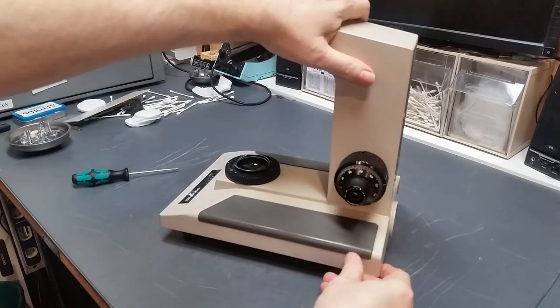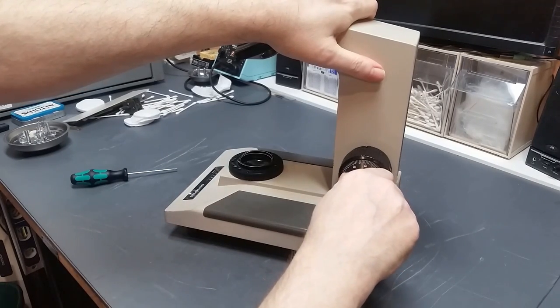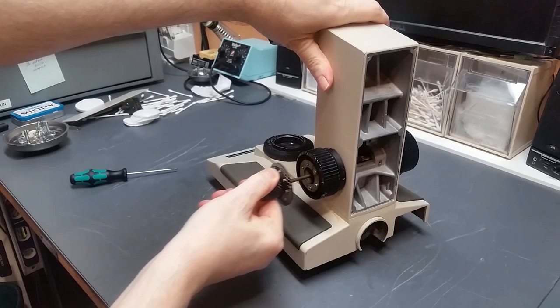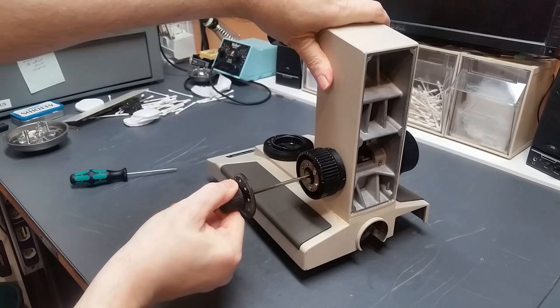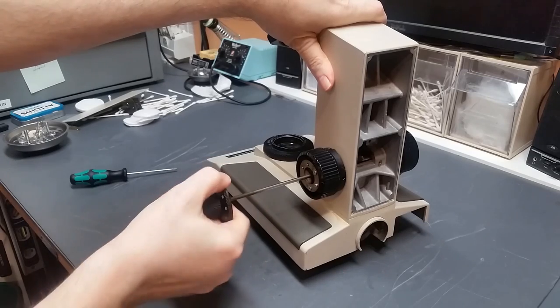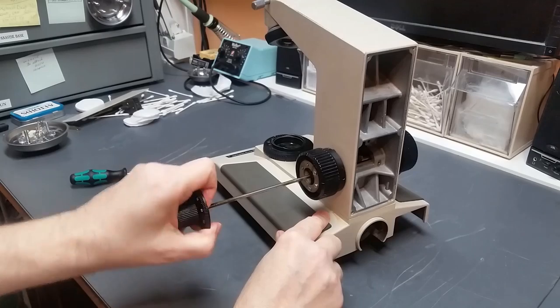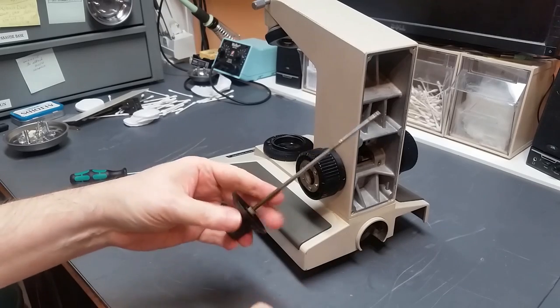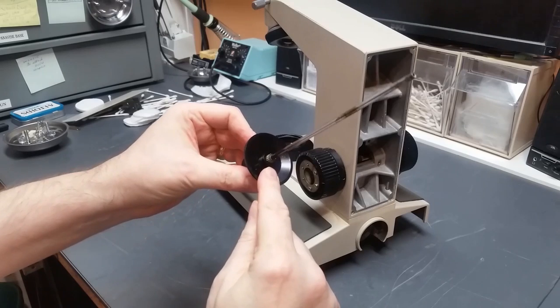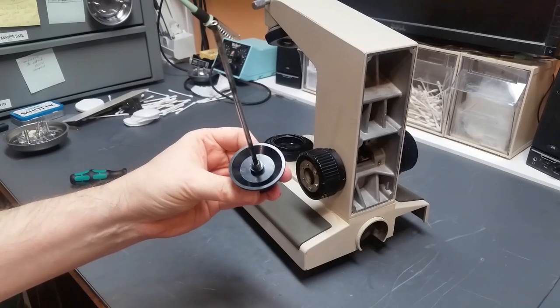Now this remaining knob on the other side still has the fine focus shaft attached to it, so we pull it straight out and the shaft will come all the way out. Okay, so this is the fine focus shaft. Here's the knob. And that little piece there is the plastic gear that drives the fine focus mechanism.